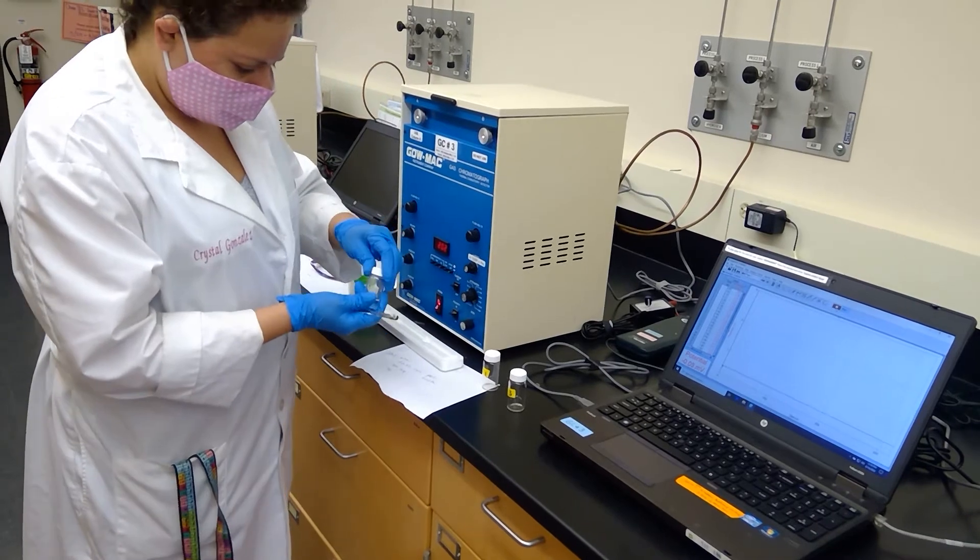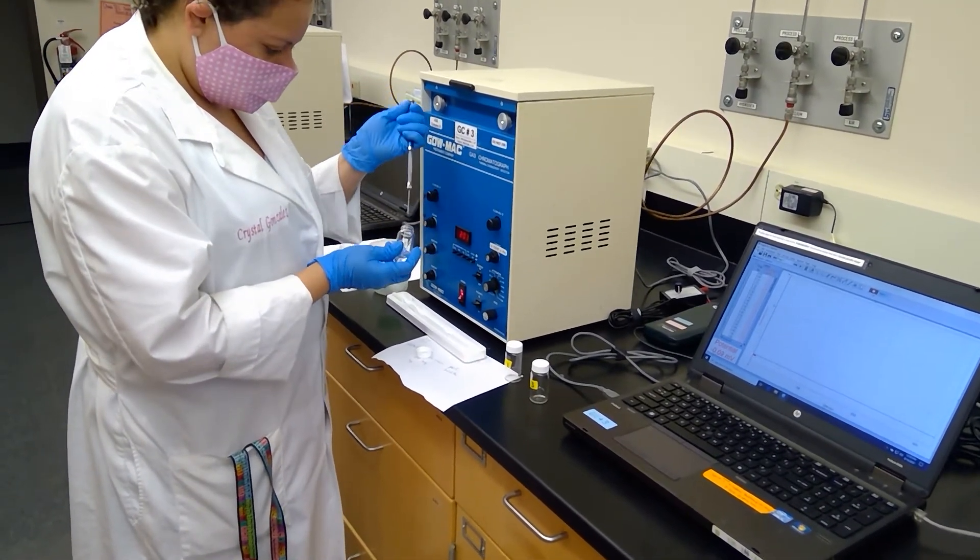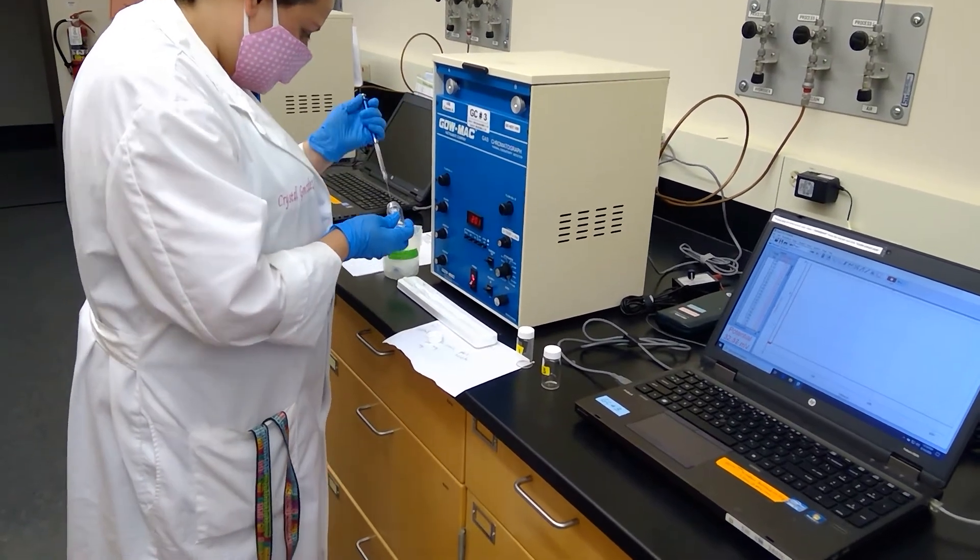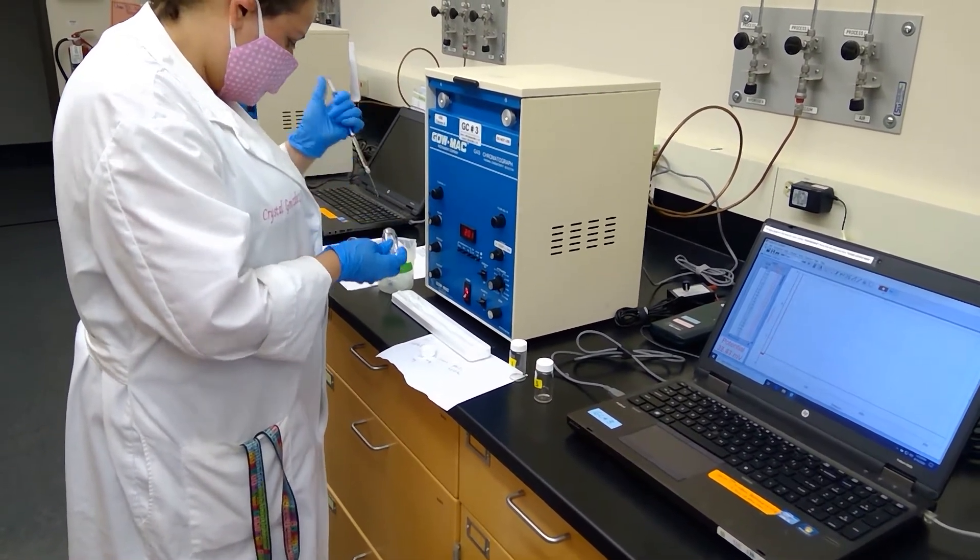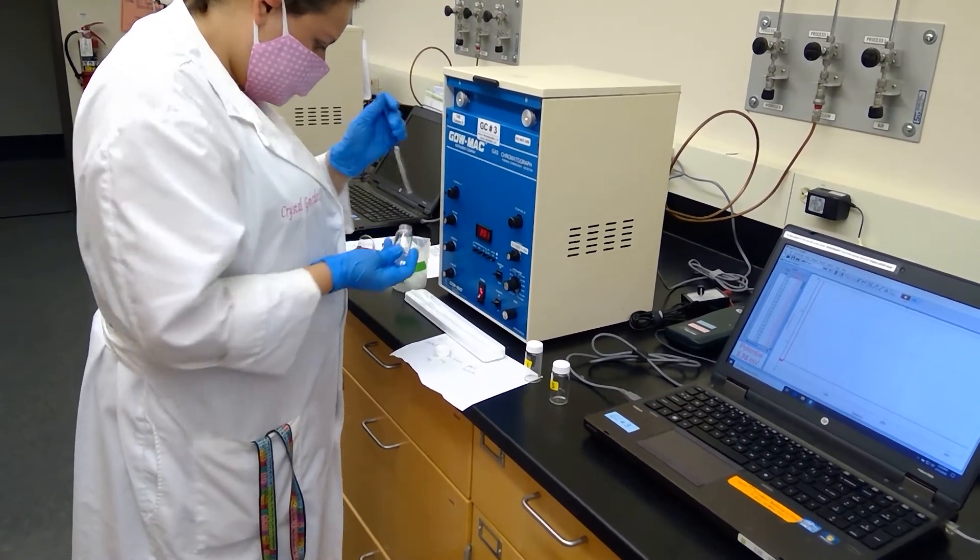So now that I've injected the sample, I'm going to repeat my washing, just to ensure my Hamilton syringe stays nice and clean.